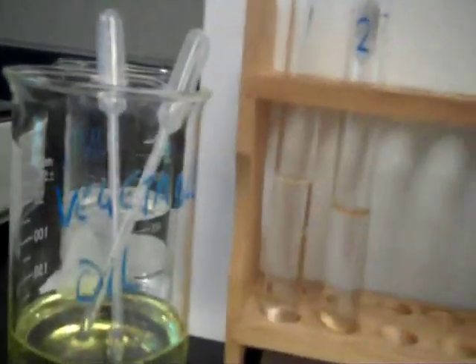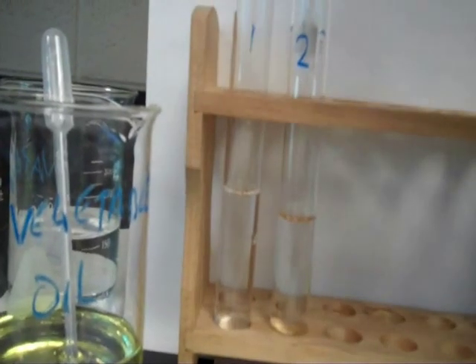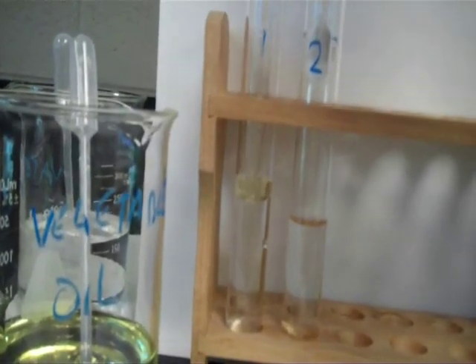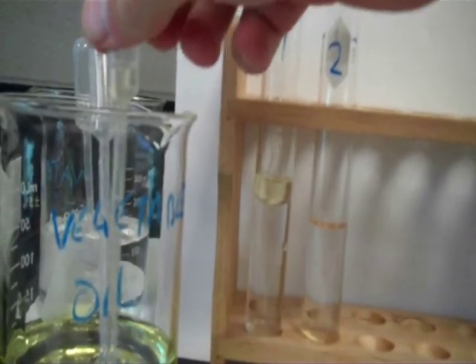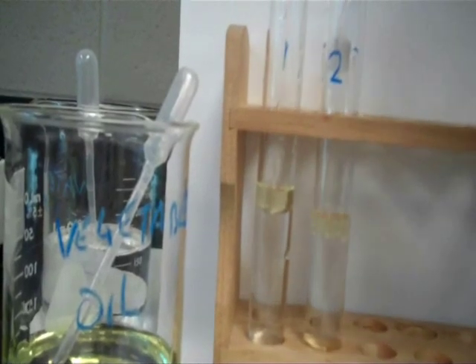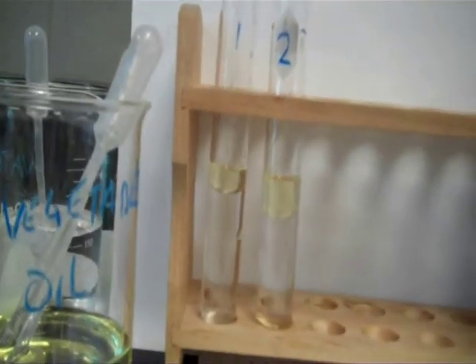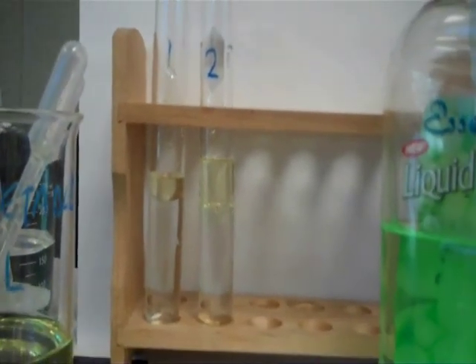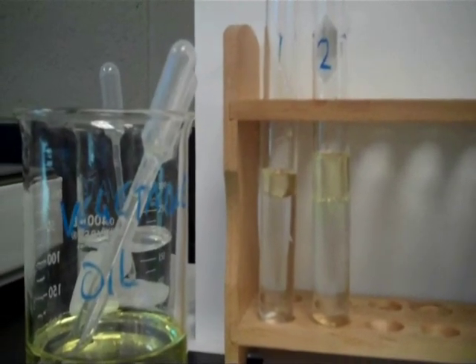For the emulsification of lipids test, we will fill two test tubes with water, then add some vegetable oil to each of the test tubes. Notice right away that lipids are non-polar and water is polar, so oil and water don't mix. In order to get oil and water to mix, we need something called an emulsifier — something that will allow the oil to mix a little with the water. Now we're going to add some soap or detergent to test tube number two.